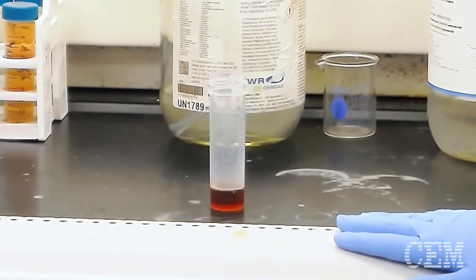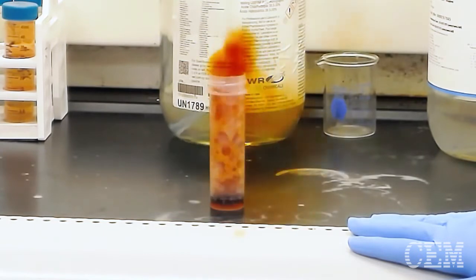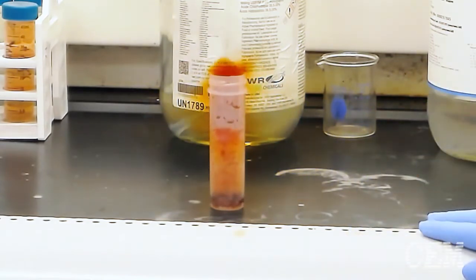One reason why we predigest is to make sure that we're driving off the exothermic reaction that is taking place. We want to make sure that we do this so that we're not overpressurizing our vessel. CEM generally recommends a 10 to 15 minute predigestion period inside of an open vessel in a fume hood. This is the reason why we do it open vessel in a fume hood.